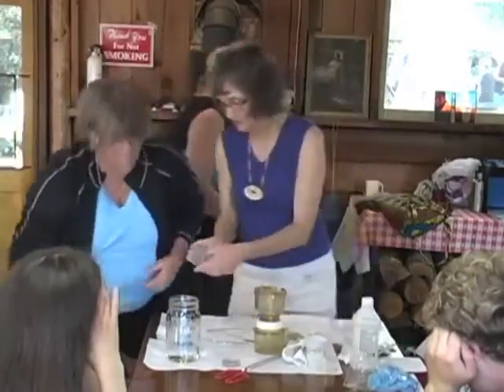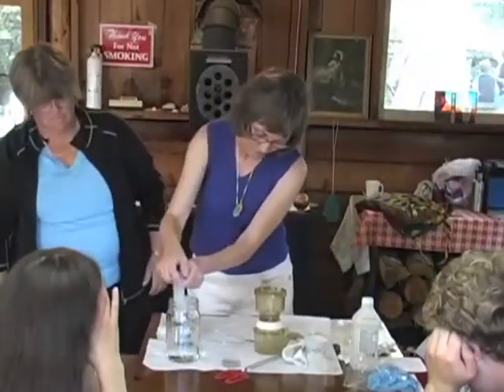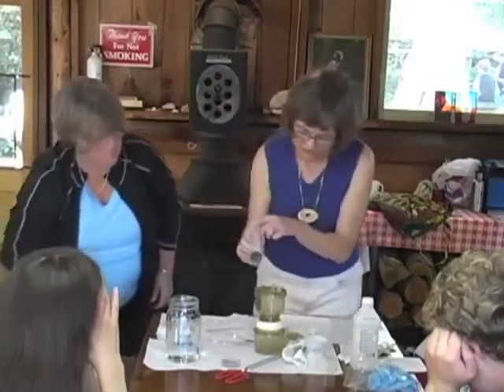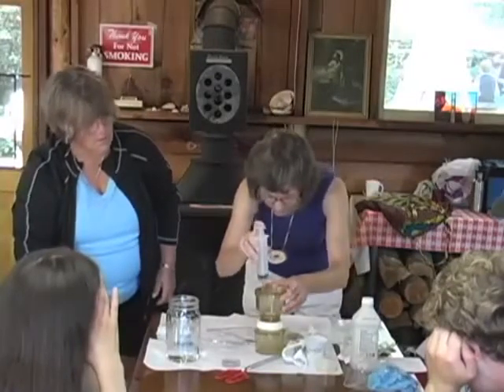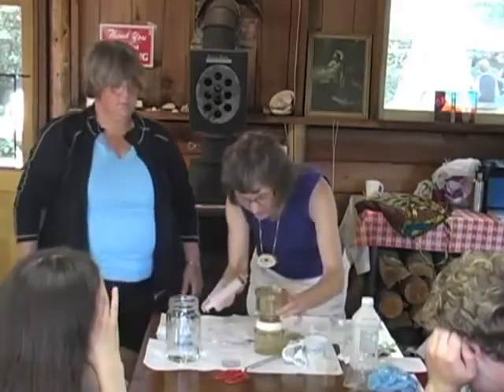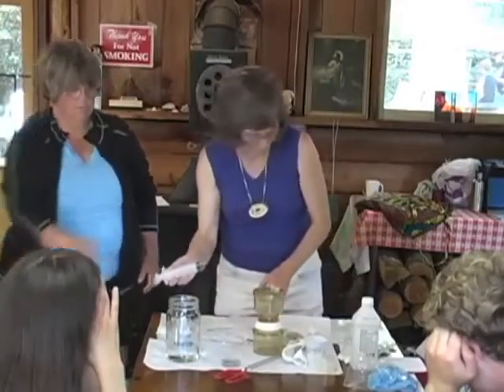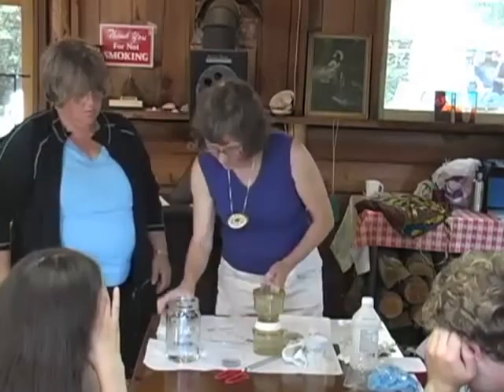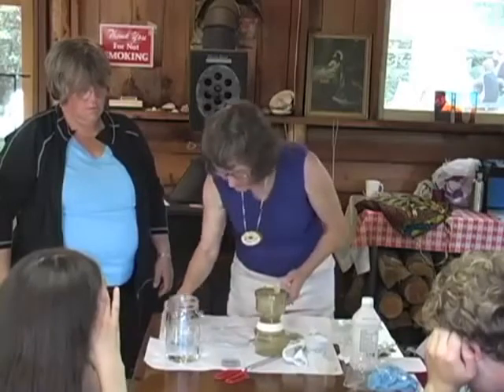And I could just draw it out of there. Yeah, it is. I'm not doing the QAQC. Okay, so that's just to wet this a little bit. Do this. That's part of my job. All right, it's supposed to dampen that. It was a little more than I was supposed to.